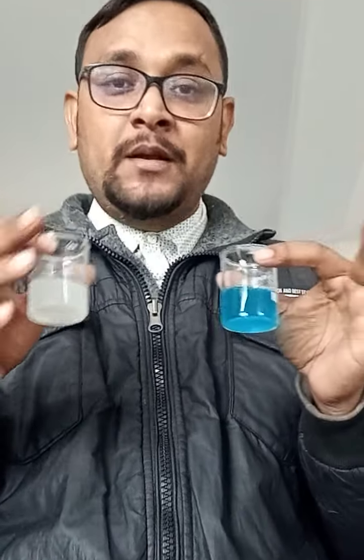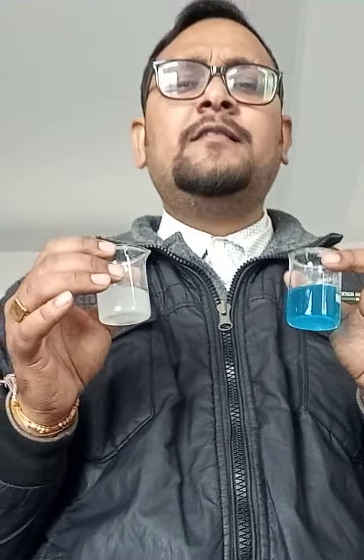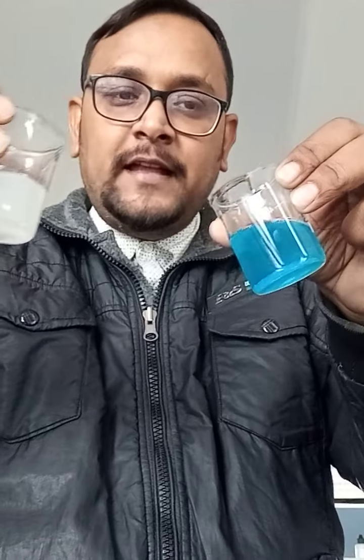Now it's time to explore what happens if I add these two. But I will get only one chance because I have prepared this solution in the beaker. So let's see what happened. Again I'm holding it like this.